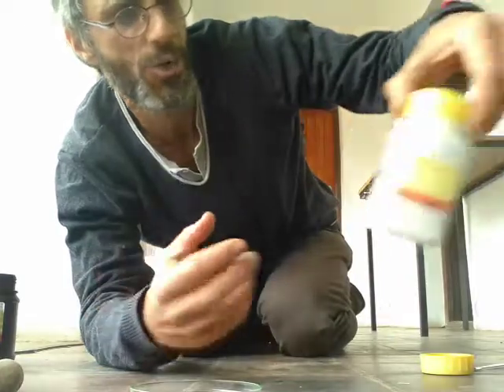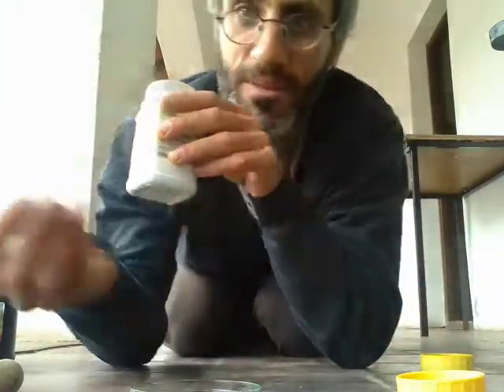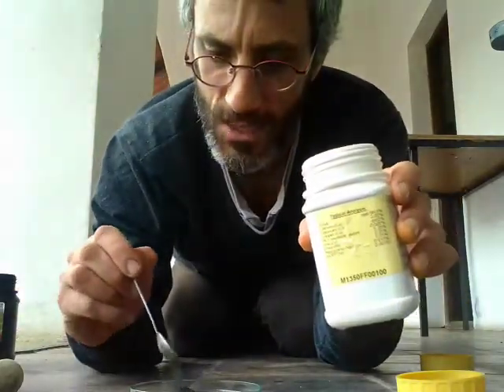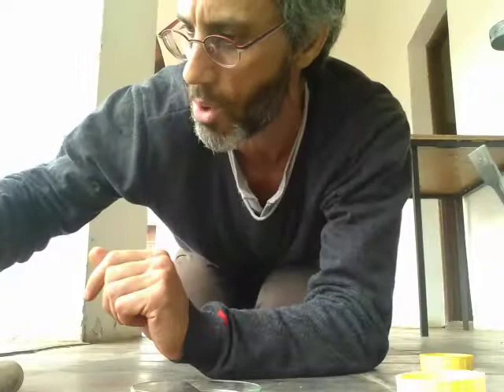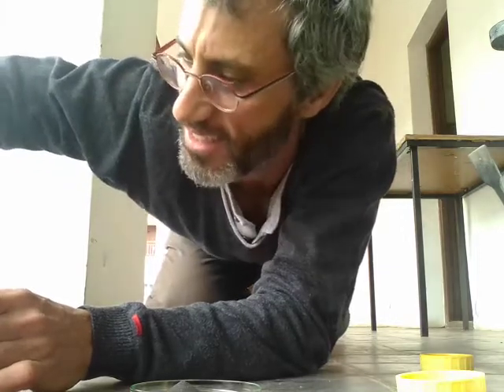What I'm going to do, I'm going to react it with magnesium, okay? Magnesium, a minute ago I showed you that in a strip, like a metal strip, but it actually can also exist in a powder form, okay? So I'm going to mix these two together, magnesium and iodine. Let's put a little bit more iodine, eh? Crush it. I need to crush it into a powder. And so far, nothing really happens, isn't it? Okay, it's a little bit boring.